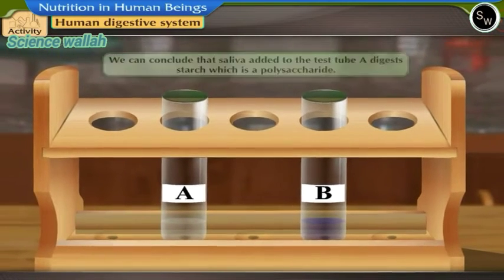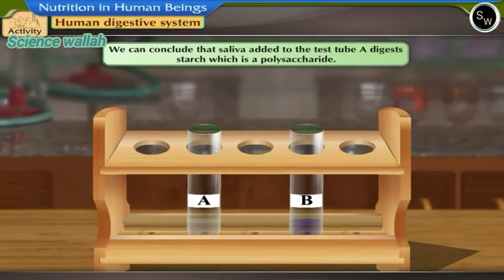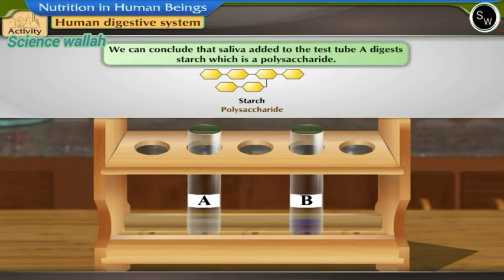From this activity we can conclude that saliva added to test tube A digests starch which is a polysaccharide.